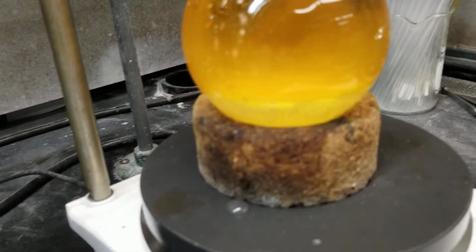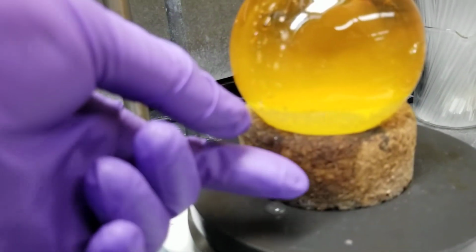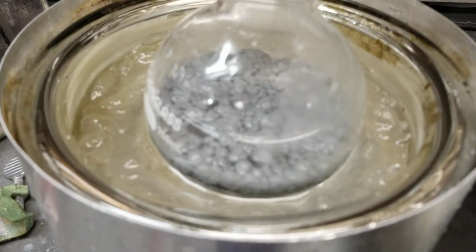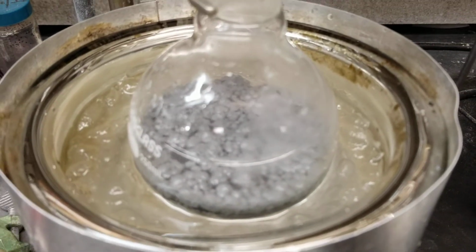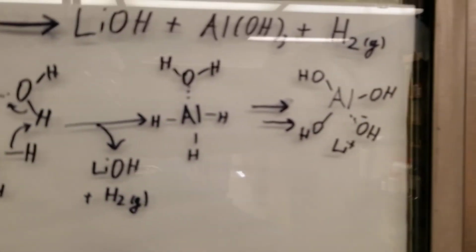You can see here, I dumped in water, and we have all my organic material sitting on top of that water that I threw in. I threw in a little bit of acidic water. And in this case, it's still very chunky. It's not dissolving well. I'll probably have to introduce a little bit more acid to help form that aluminum hydroxide that I was mentioning here.